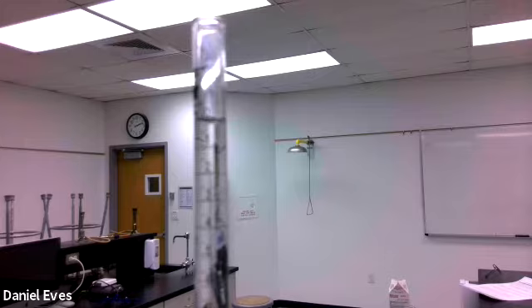And then once I have that information, I can use this solution of sodium hydroxide to tell me about some other things that I don't know. And so that's the whole genesis of this lab, is to make a solution, figure out its concentration, and then use it to identify information about other acids that we don't know anything about. So a known sodium hydroxide solution will allow us to determine things of an unknown acid that we're working on.